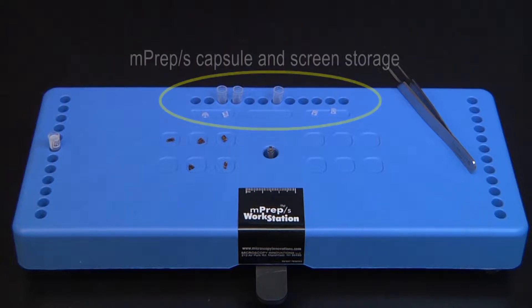The back of the workstation provides a location for storing empty MPREP-S capsules and screens until they are ready for use.